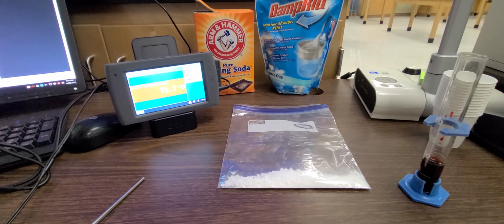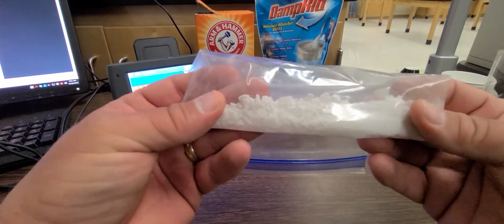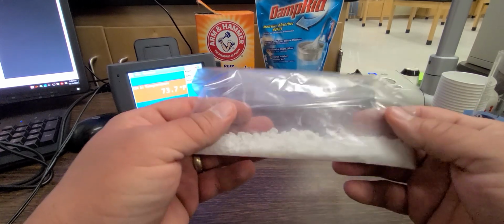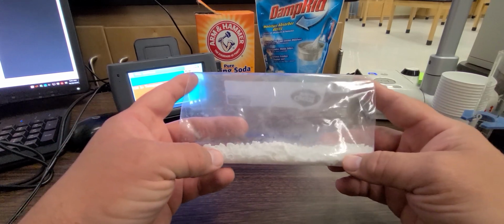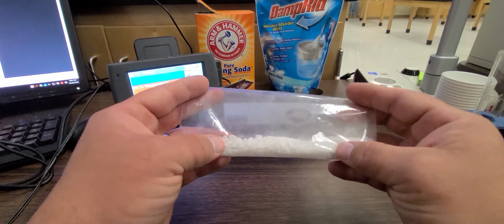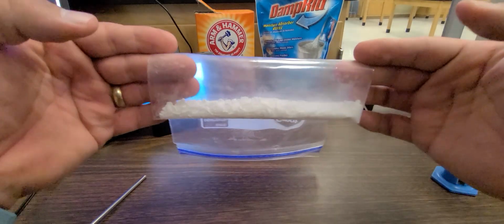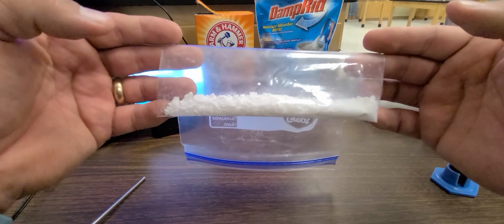And the liquid, the phenol red, kind of acts as a catalyst that gets everything going, because you should have noticed already that there is no chemical reaction taking place inside the bag right now. So what I'm going to do here in just a second is pour the phenol red into the bag, and then immediately zip the bag closed so that if there is any gas production, we can trap it in the bag. Even though you might see more evidence of that as we go through it, I do want to try to trap any gas that is being produced during the reaction.